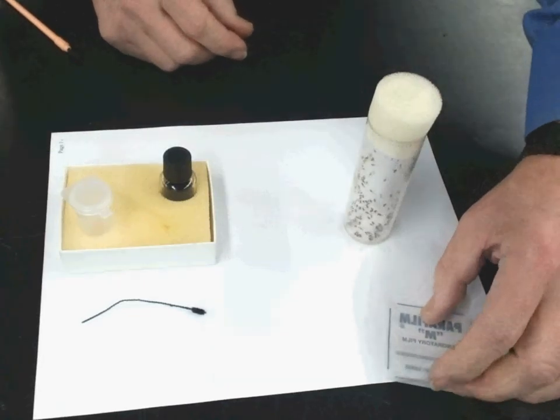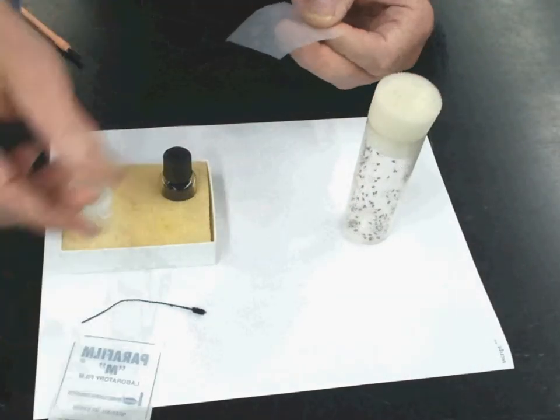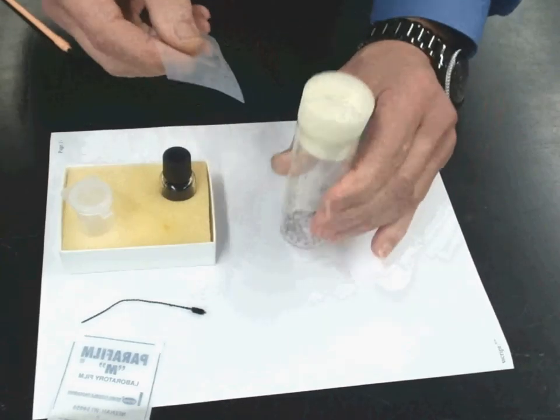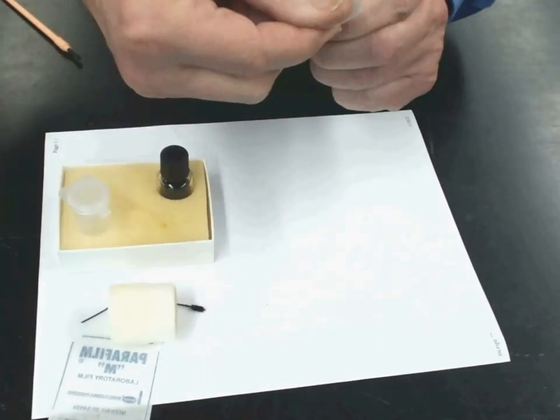Now you're going to prepare your parafilm to cover the anesthetization vial with all the adults. You can do this quickly. Make sure it is done.